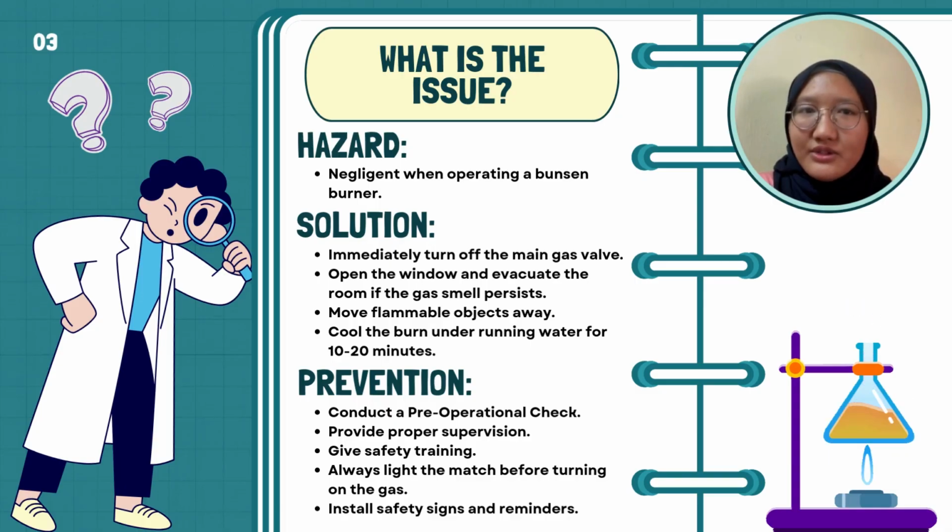So what is the solution for this? Firstly, we need to turn off the main gas valve, then open the window. If the gas smell persists, immediately evacuate the room. Next, if there is a flame involved and it is not extinguished yet, remove flammable objects away if you can and put it out using a fire extinguisher.